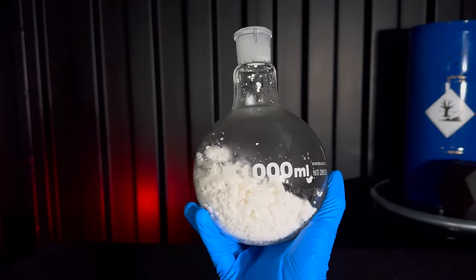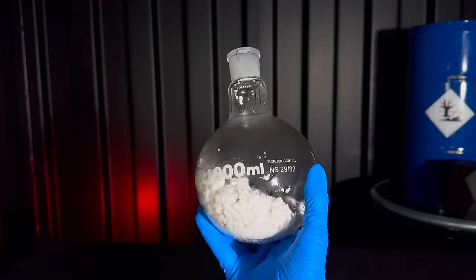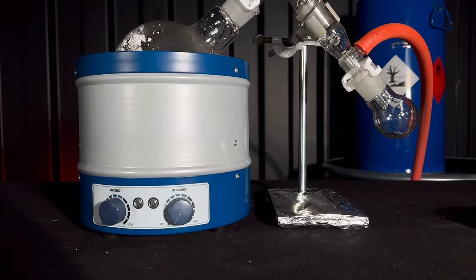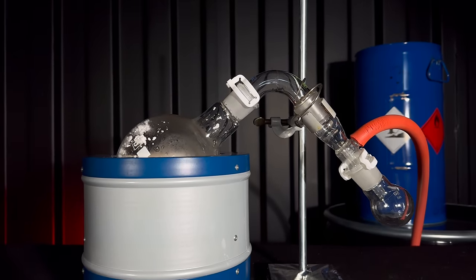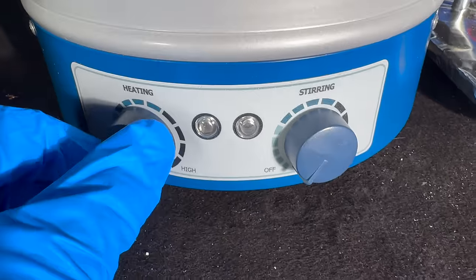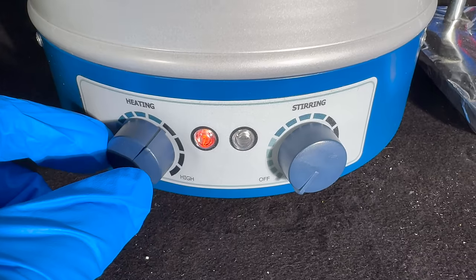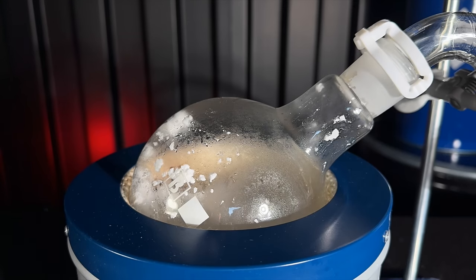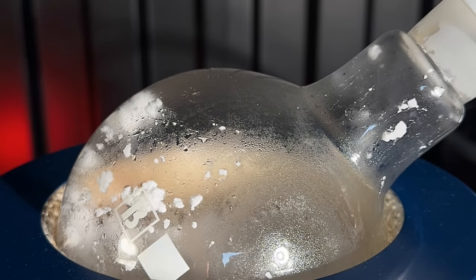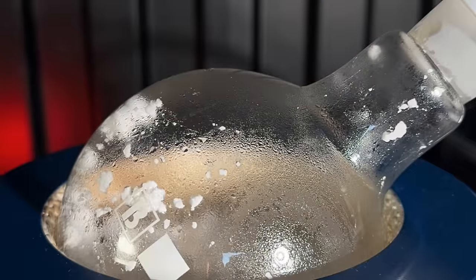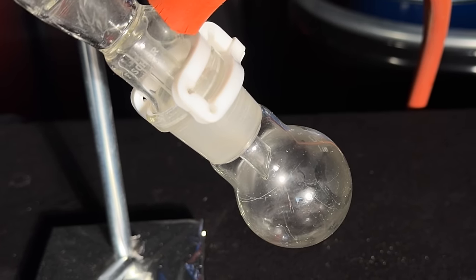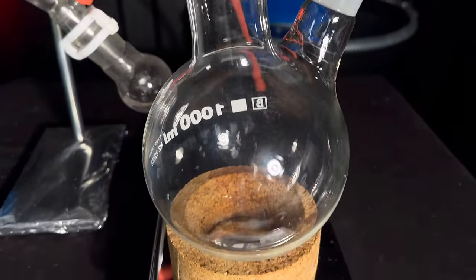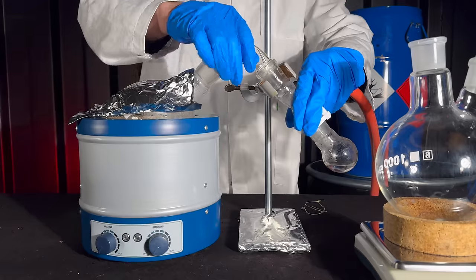When you look closely, you can see condensation on the wall of the flask. There was 126.1g of wet powder and this means there's still a lot of water in it. With a bent glass pipe, I connected it to another flask. I tried this before and used a condenser last time, which was a big mistake. Last time, the condenser clogged up, leading to overpressure, a stopper flew out and the entire room got filled with nasty phenol vapor. To get rid of a fraction of residual water, I first connected a small flask and later changed it out for a bigger one.